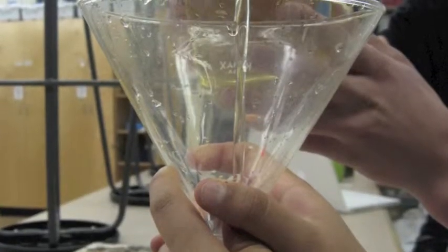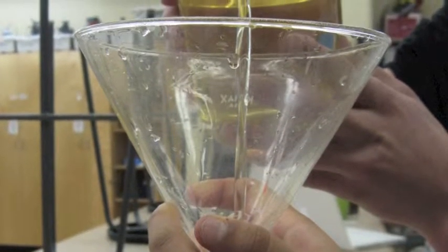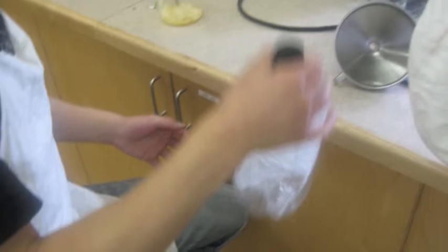Open the plastic bottle and, using the funnel, pour the hot canola oil into the 2-liter plastic bottle. After all the oil is in the bottle, pour the dissolved mixture of sodium hydroxide and methanol — known as methoxide — into the 2-liter bottle.